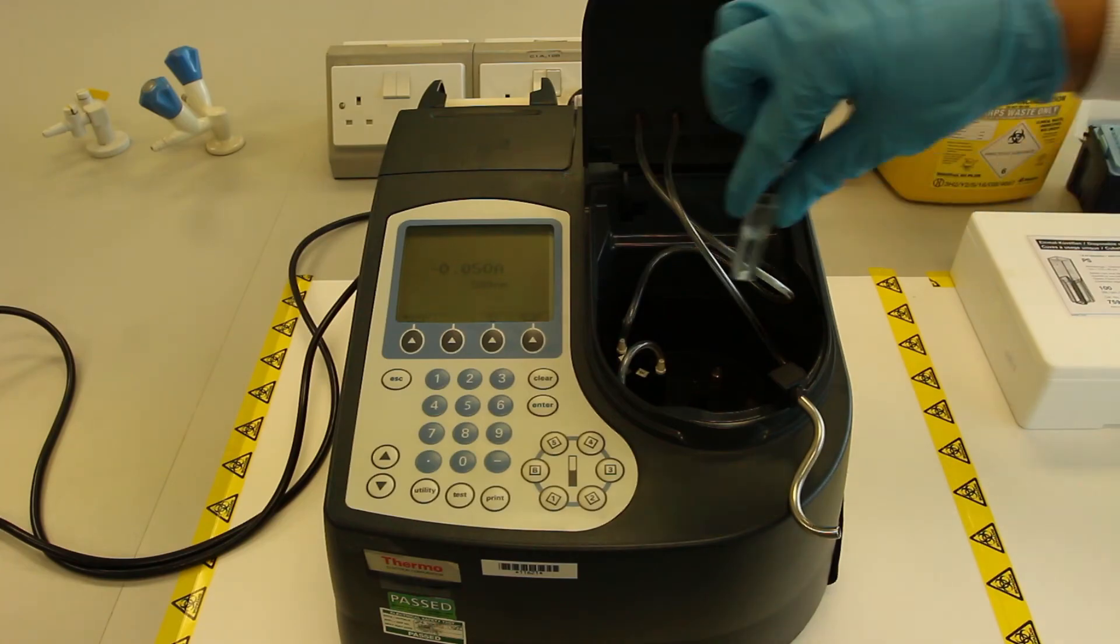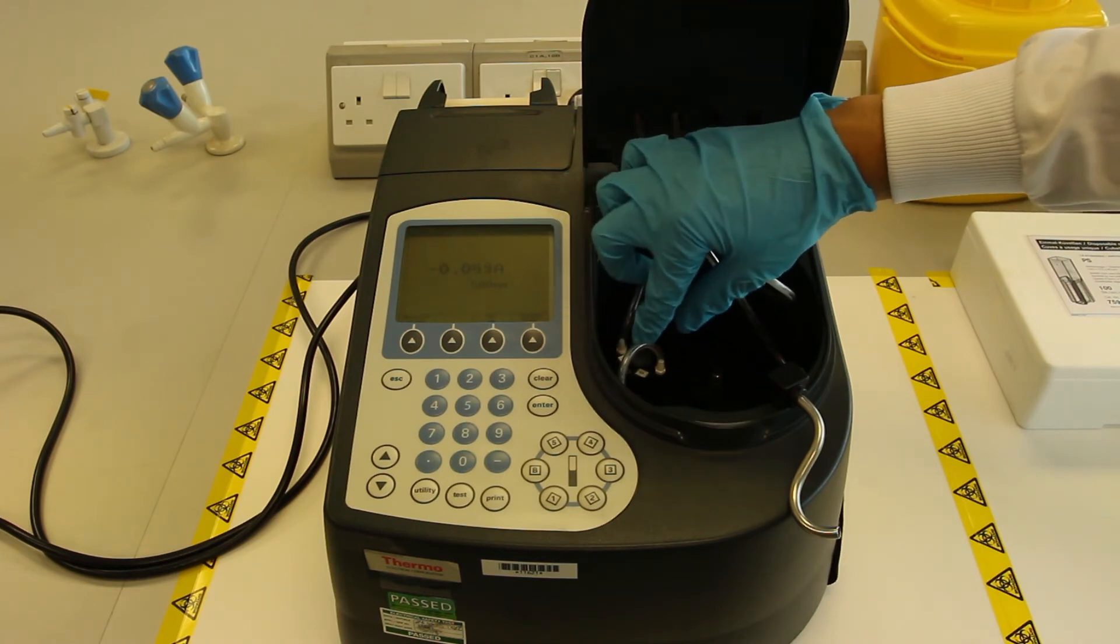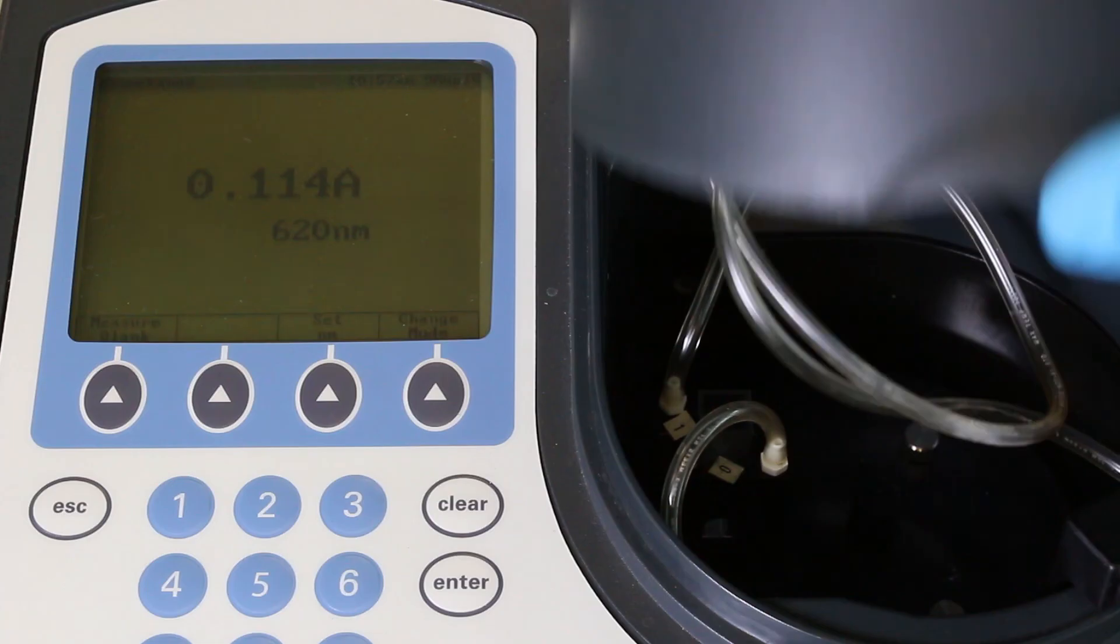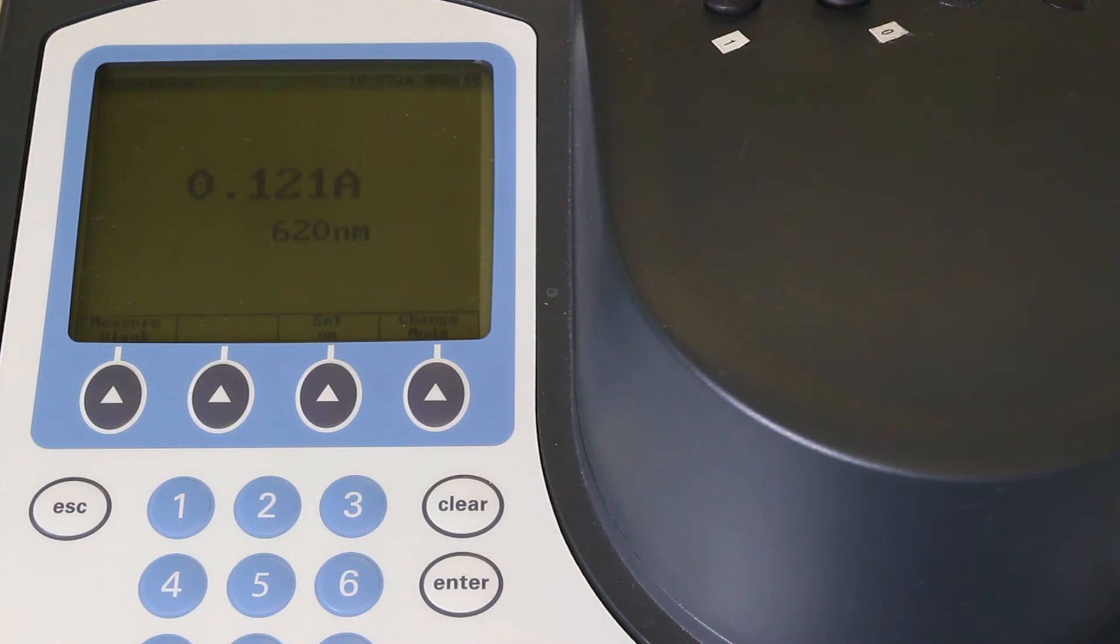Now put the cuvette containing the sample into your spectrophotometer and close the sample port. The number that you see on the screen can be recorded.